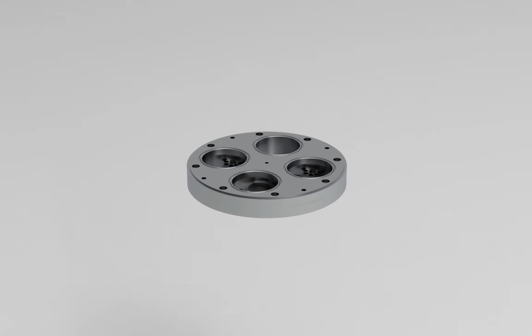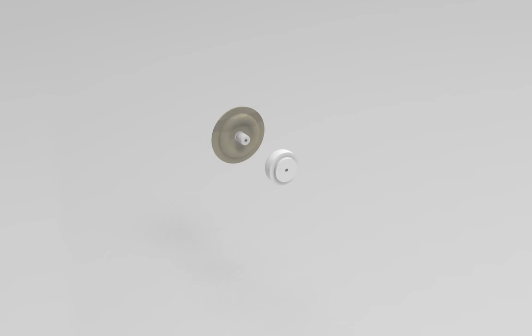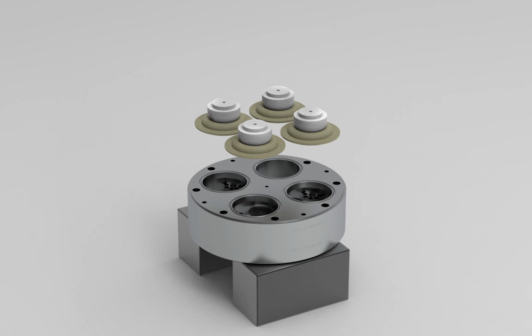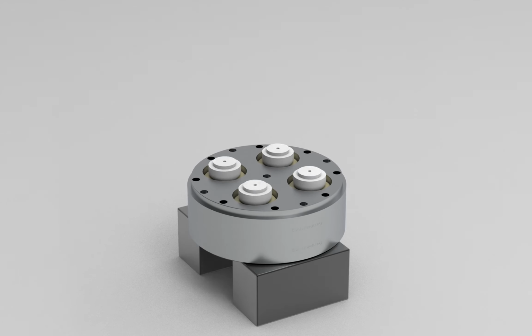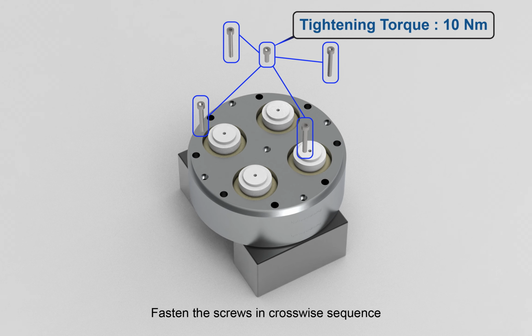Mount the valve plate along with the valves. Fasten the diaphragm support with the new diaphragm. Make sure that the diaphragm is completely screwed on the thread, such that no gap exists between the diaphragm and the support. Mount the diaphragm together with the diaphragm support. Mount the diaphragm housing cover. Fasten the screws in crosswise sequence, with the torque of 10 Nm.